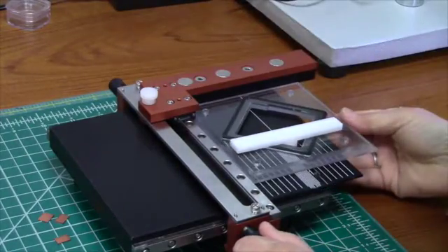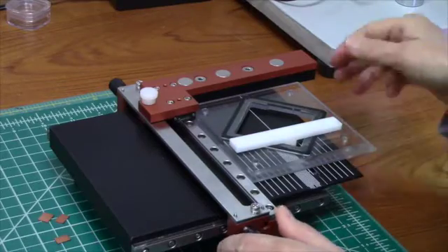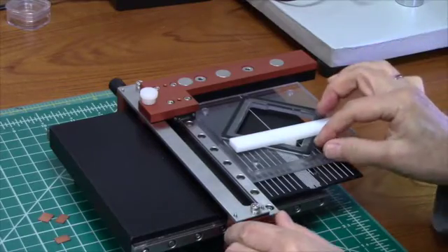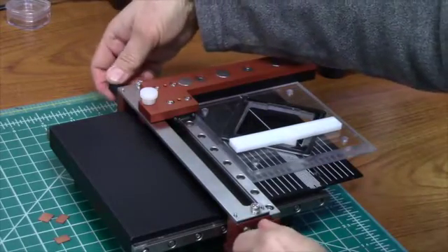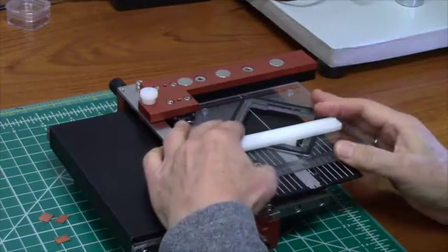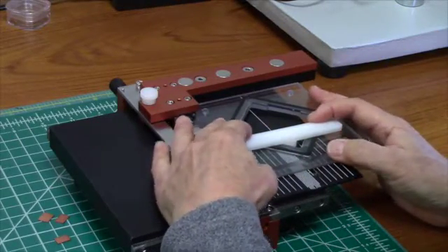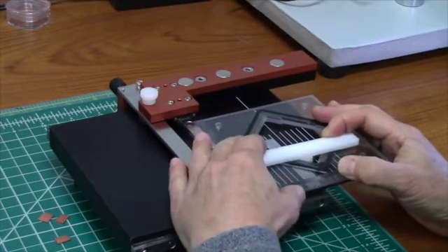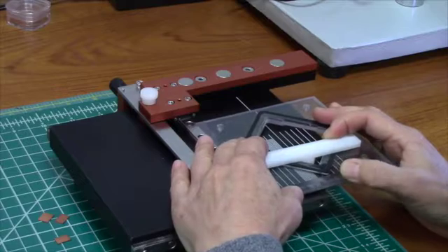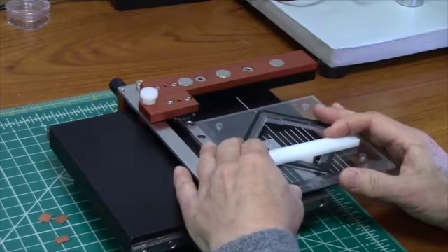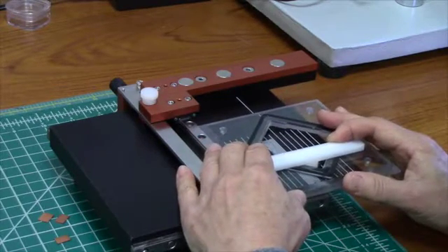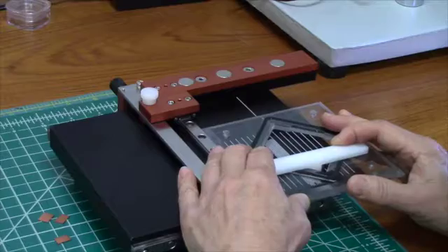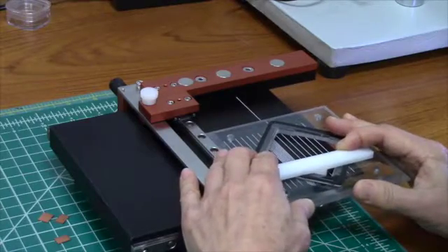I'm going to position the sample for the area of interest. I'm now going to slide the sample over the diamond scribe. I'm holding the hold down on the edge just to keep it steady, and you can hear it scribe.